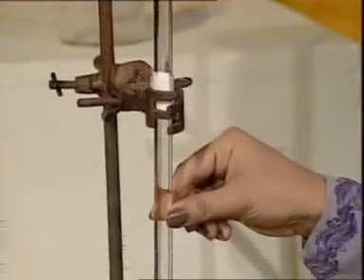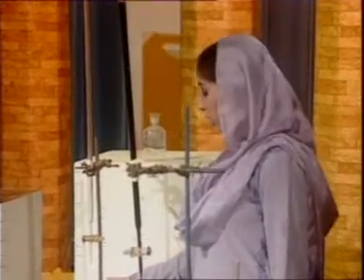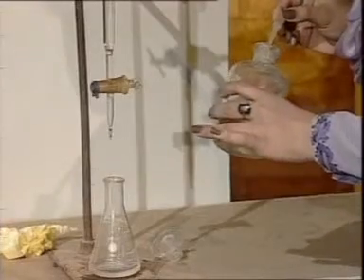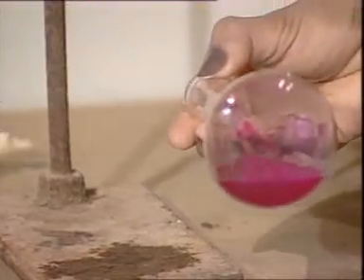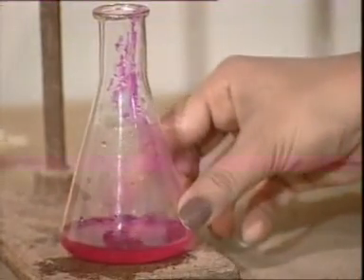Let's understand the use of an acid-base indicator with the help of a titration. Here we have taken an aqueous solution of HCl in the burette and a solution of sodium hydroxide in the titration flask. The indicator that we use in this titration is phenolphthalein. We add a few drops of phenolphthalein in this solution. Phenolphthalein imparts a pink color to the basic solution.